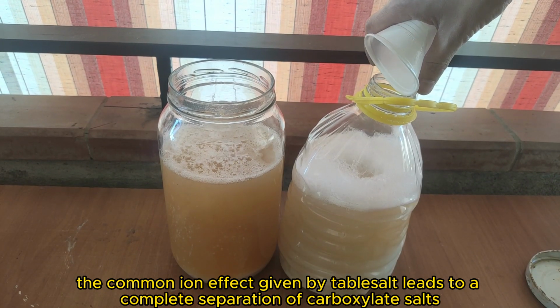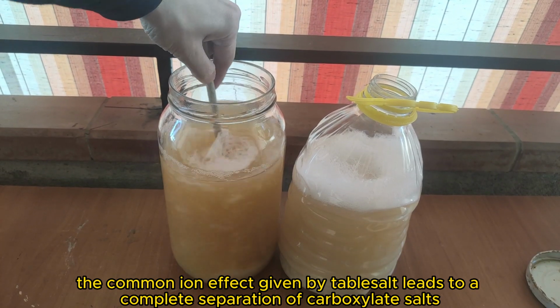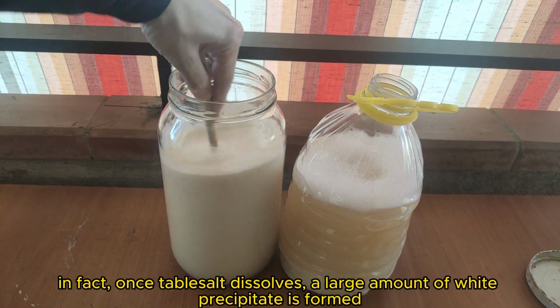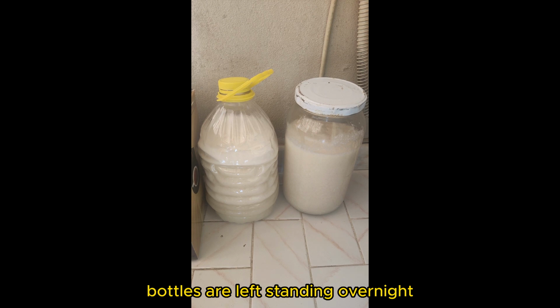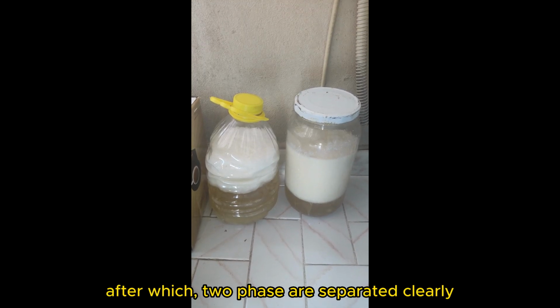The common ion effect given by table salt leads to a complete separation of carboxylate salts from the aqueous glycerol solution. In fact, once table salt dissolves, a large amount of white precipitate is formed. Bottles are left standing overnight, after which two phases are clearly separated.